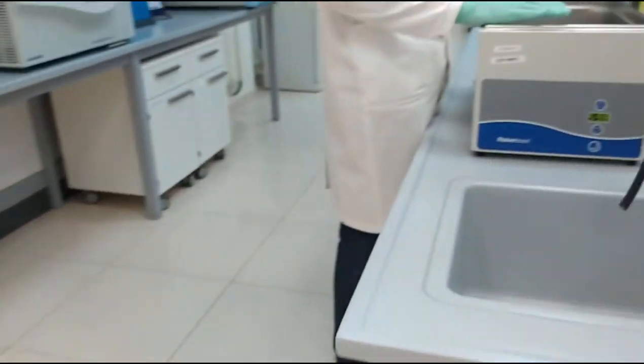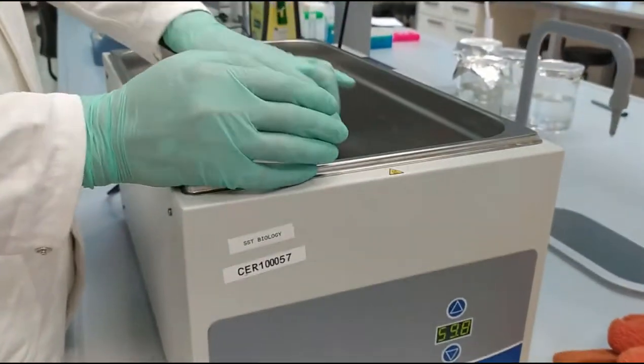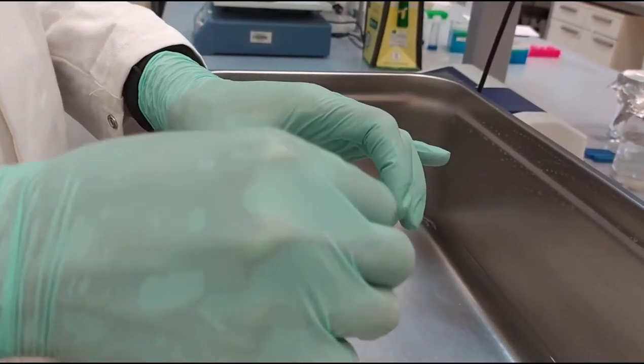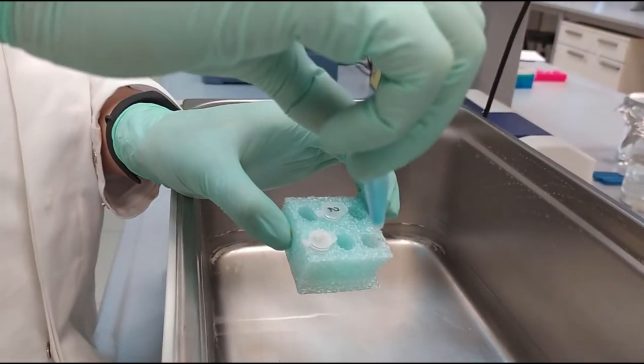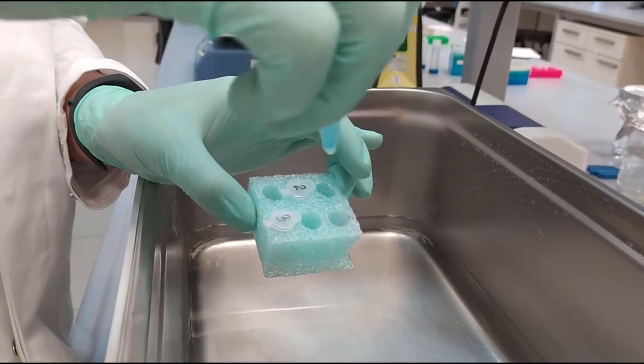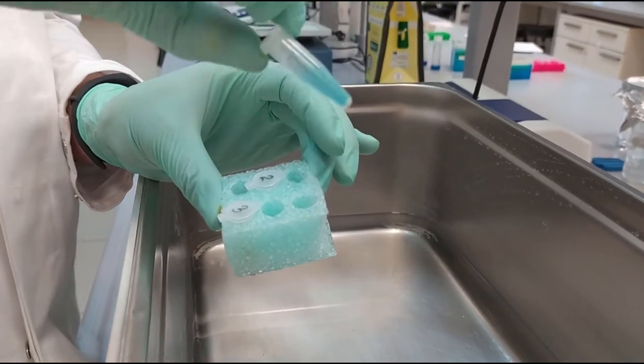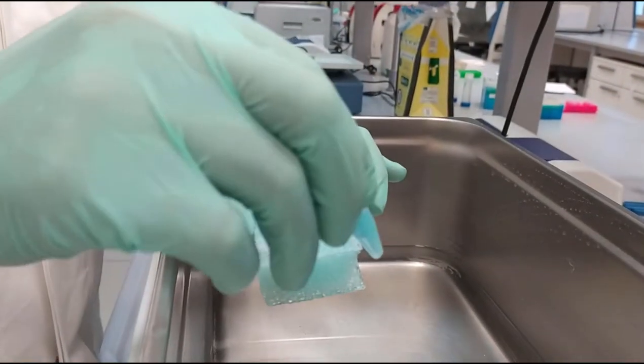Okay, so we have 10 minutes passed since we put it in the water bath. So now we should see the difference in the color or in the consistency. So for the first solution, there is not much stuff happened inside.